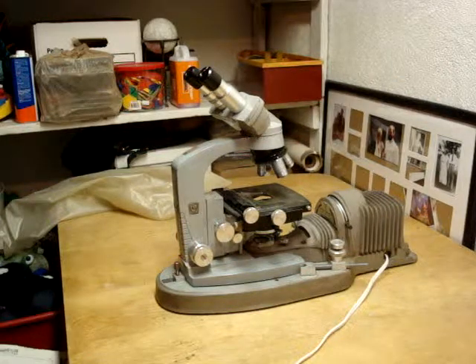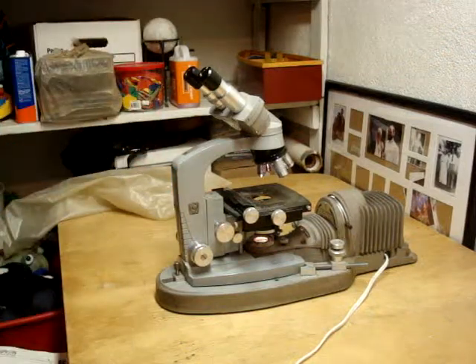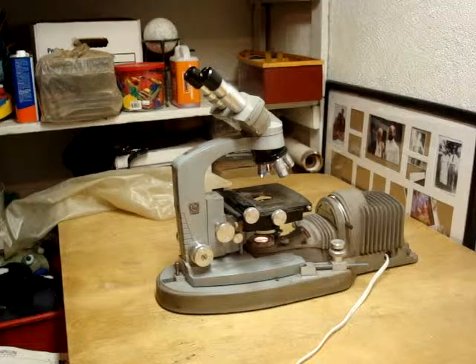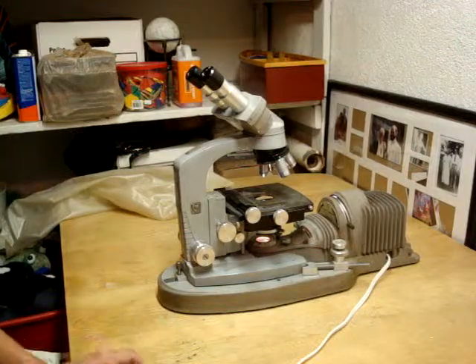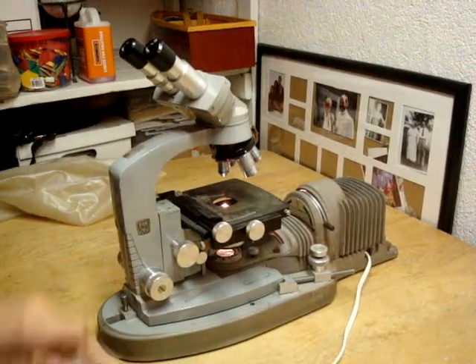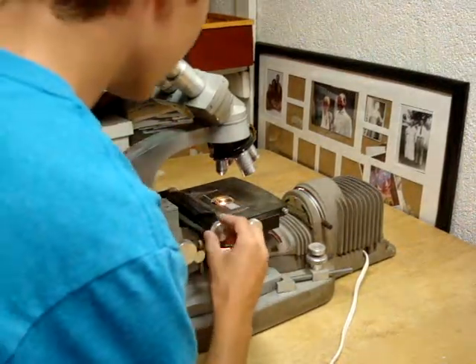What you want to do is you can turn on the microscope, which is right there, and you can find the slide that you want to put on it. Put the slide on here and center it in the center just like this.